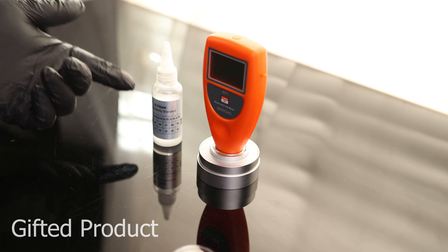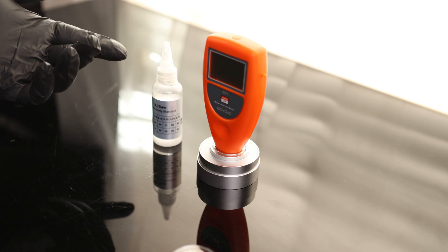Today I'm going to be showing you how to calibrate the water activity meter using pre-mixed fluid. If you don't want to mix your own stuff, we can use this.